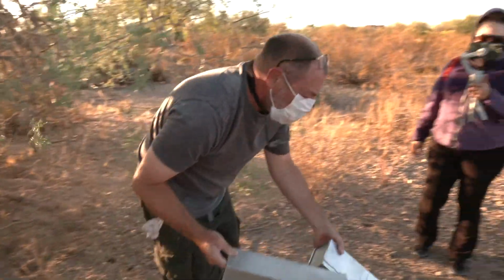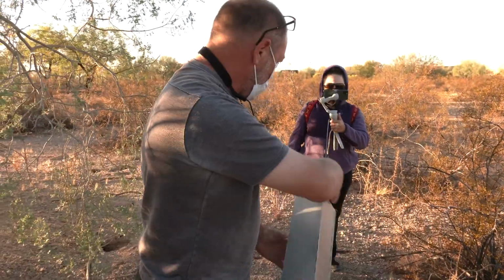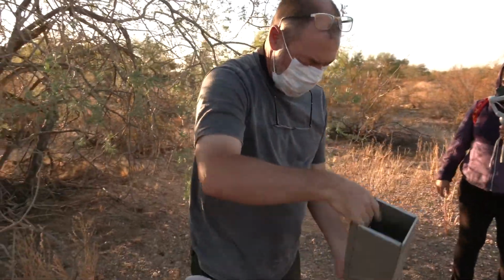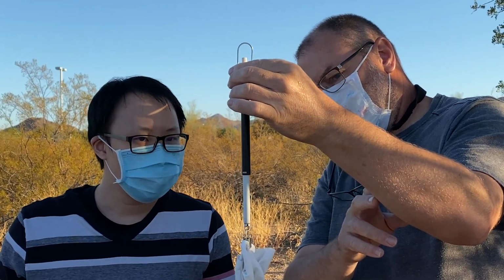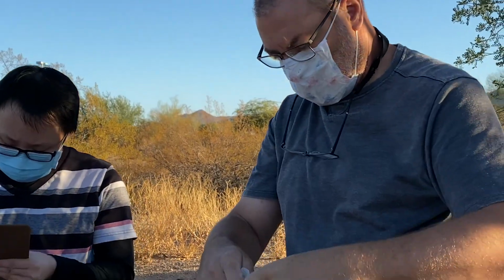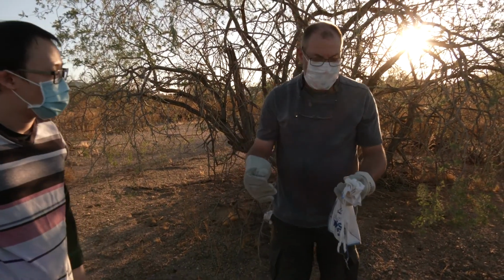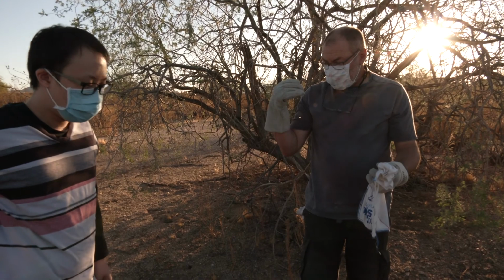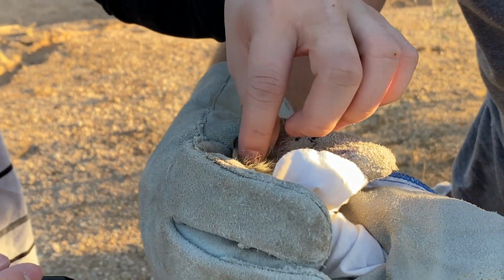Okay, so one trap closed, the other one empty. 210. Yep, good, 210, 210. So this animal we're going to be doing outside right here. Is that right? It's where we're at? Yeah. Ooh, so this one's got a tear in its ear.